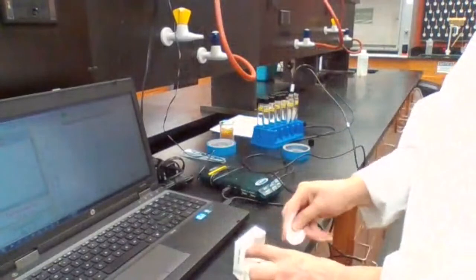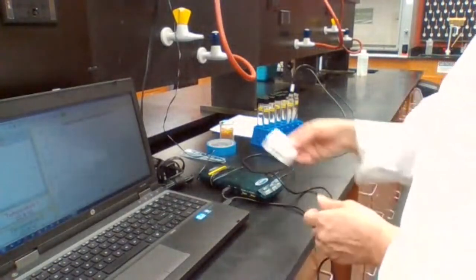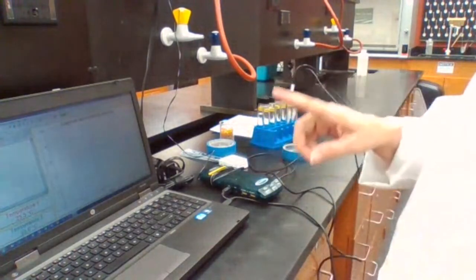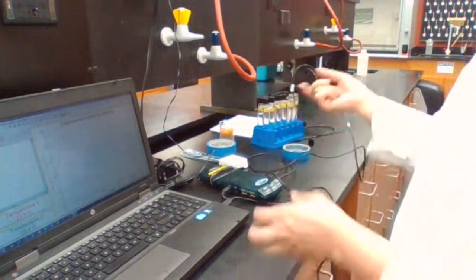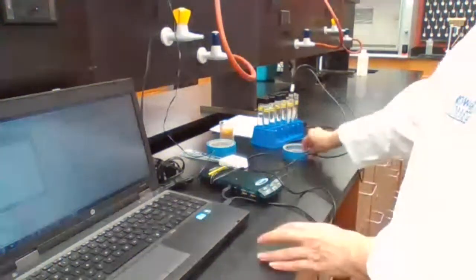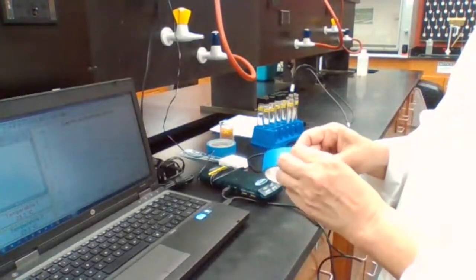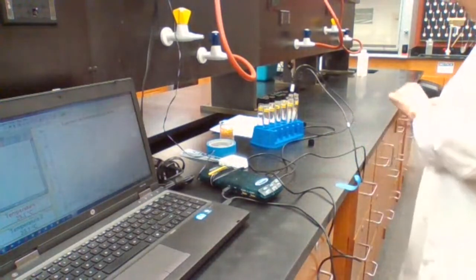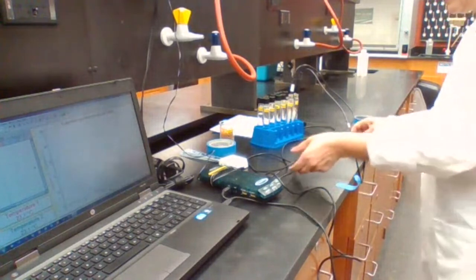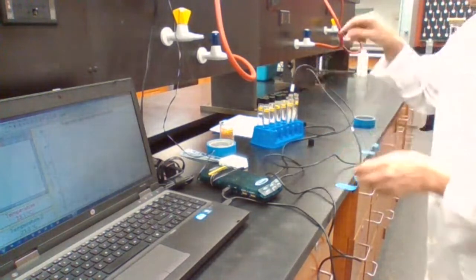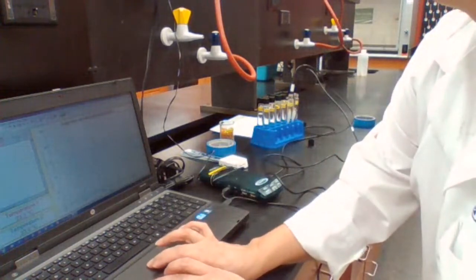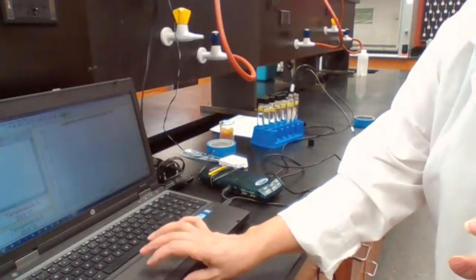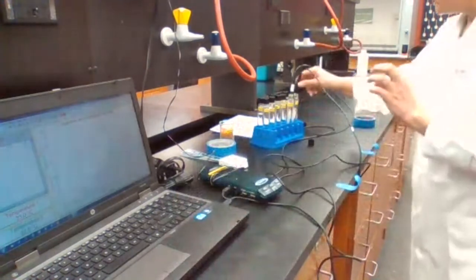When I click collect, it's going to record the temperature so I can then go back and see what was the lowest temperature that it will reach. After the 45 seconds that they are in, I'm going to start collecting. When I collect, then I take it out and tape it to the bench side. Let me get my tapes ready. Channel one, I have to start collecting first.